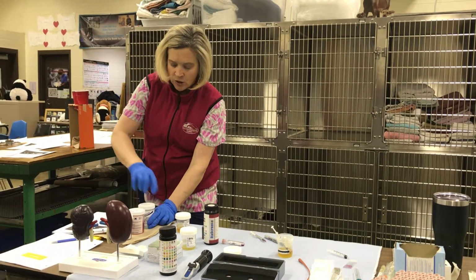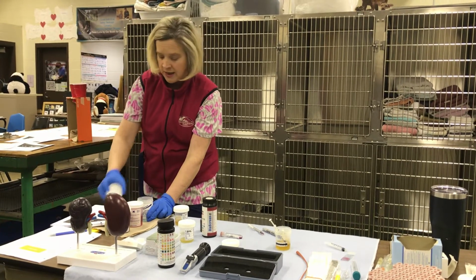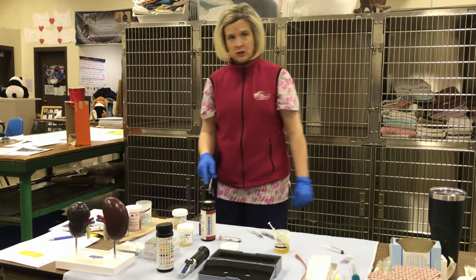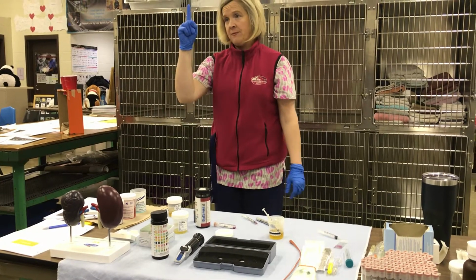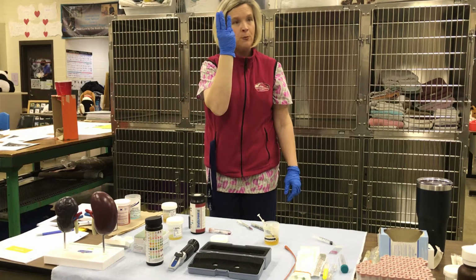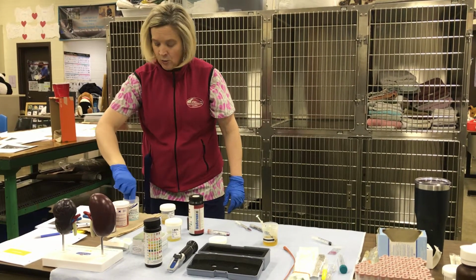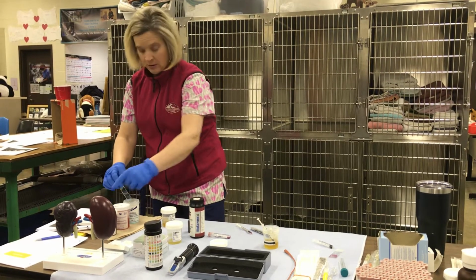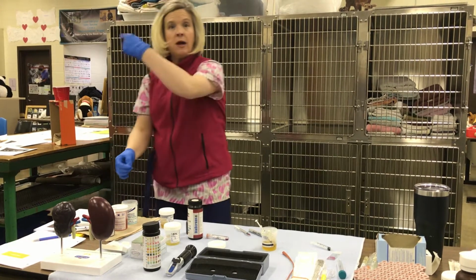With that, we're gonna start with our diff quick stain. This is a 3-step process, okay? So first step, you're going to place your microscope slide in each step of your stain for 1 minute. You start with your blue, red, final step is the purple, okay? So you're gonna keep that in there for 1 minute. Once you're done with the purple, okay, you're going to take your purple and you've gotta wash it off.